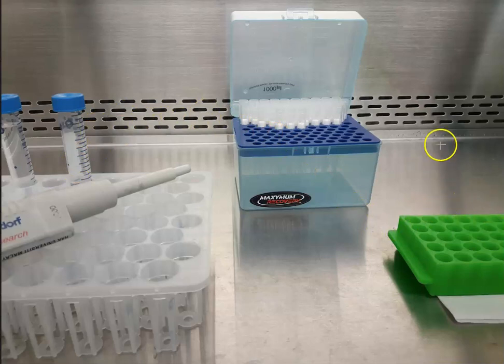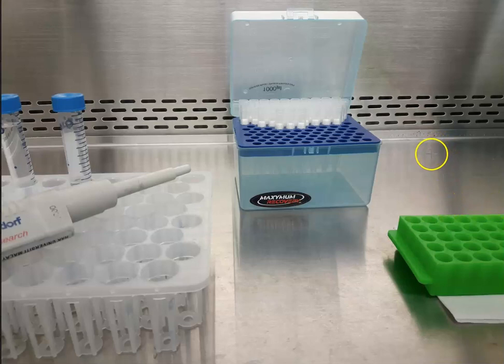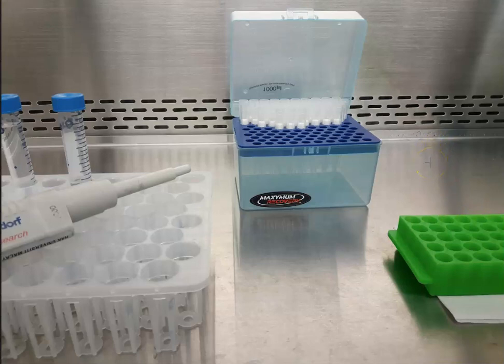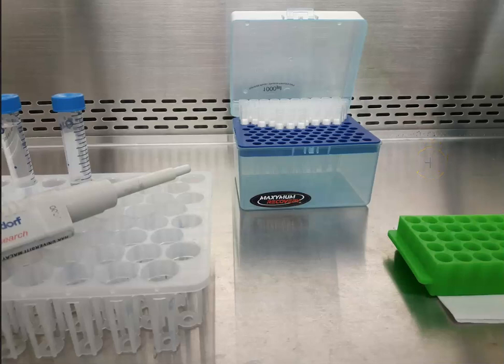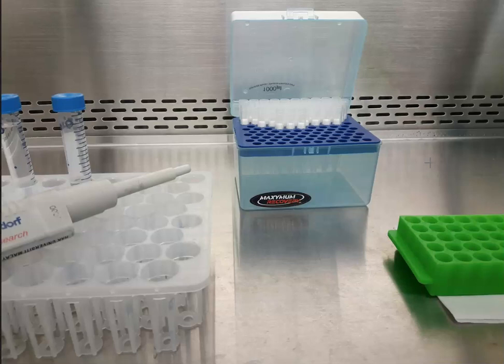This is basically an introduction to working in the biological safety cabinet. I have prepared another video which will describe operations in detail. Thank you very much for watching this short tutorial. Stay bio safe.